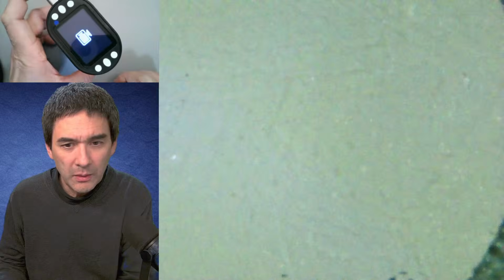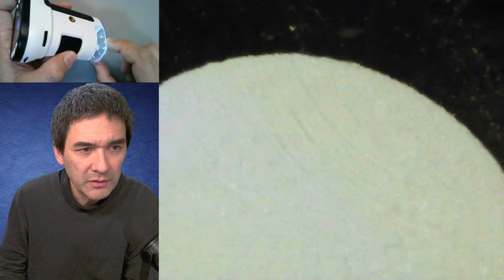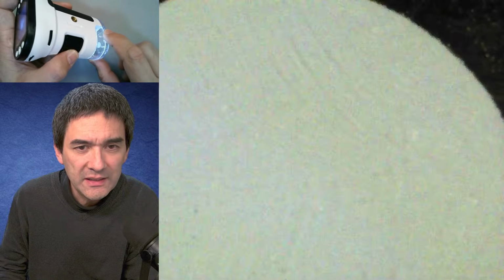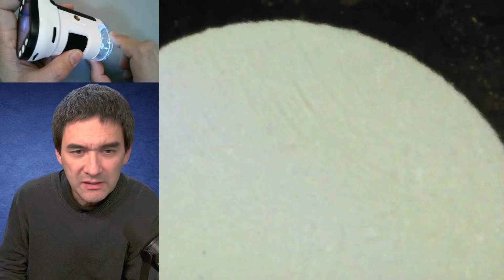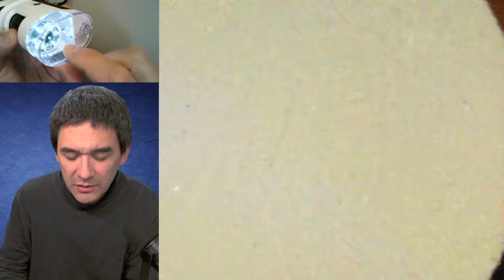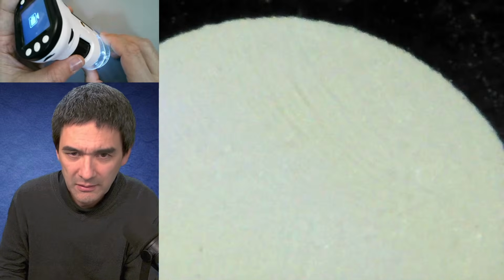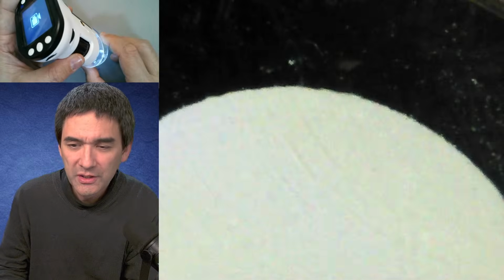Okay. Let me show this to you first. Look what I'm doing right now. I'm just moving the dust cover to the side a little bit, right? And what you see over here is that there is this white disc, right? And at this magnification, can you see the edges, right? The disc is not even large enough, so it's not giving you a complete white background, which is a pity.